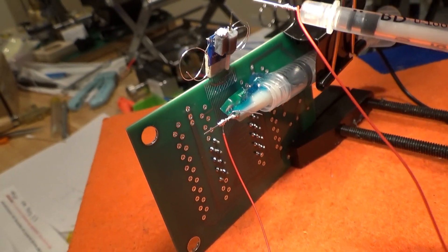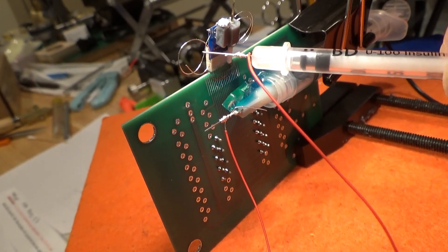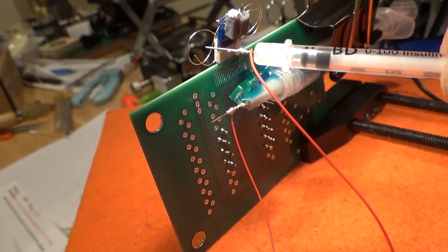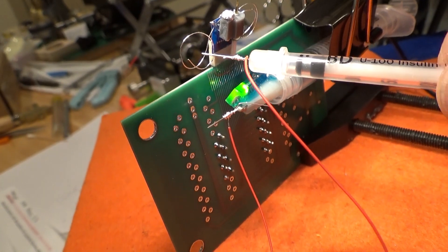When I probe the tips of the wires and find the correct channel, the LED lights up and I'm able to see that in the microscope, giving me confirmation of continuity.